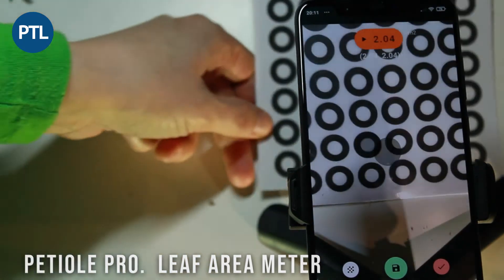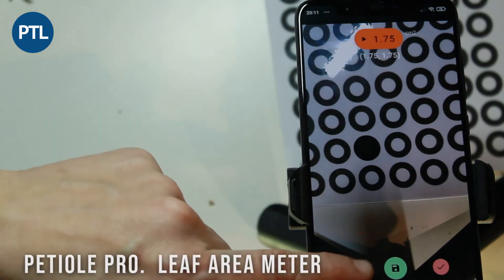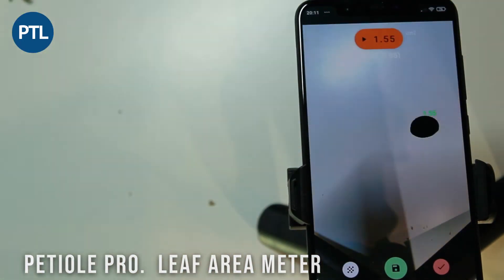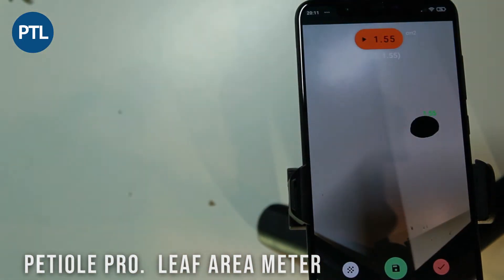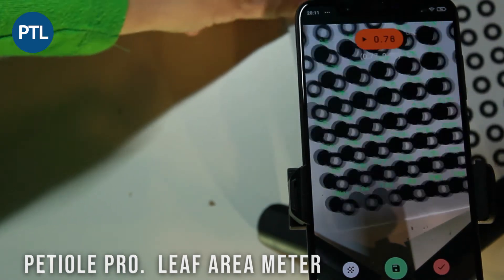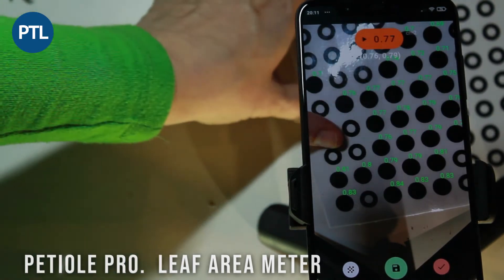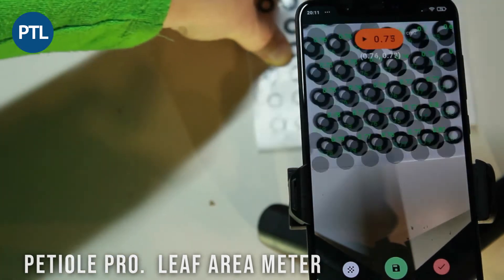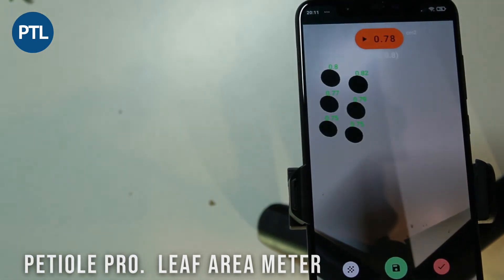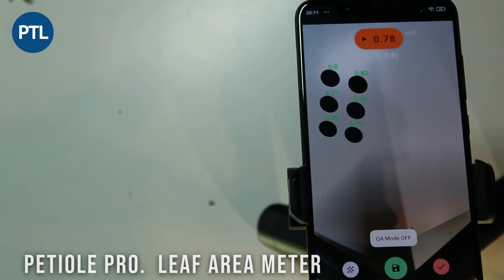After calibration, you can place the accuracy checking pad in front of the camera. If you press the left-hand side button with the chessboard, on your screen you will see the accuracy of measurements for all of the circles which are visible to the camera. You can download these pads using the link provided below this video.